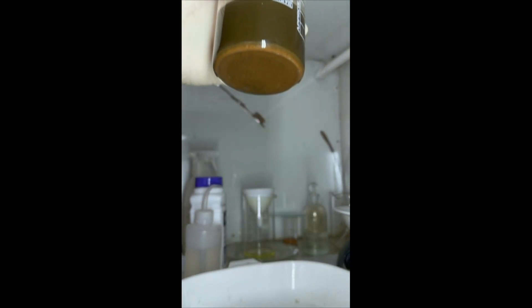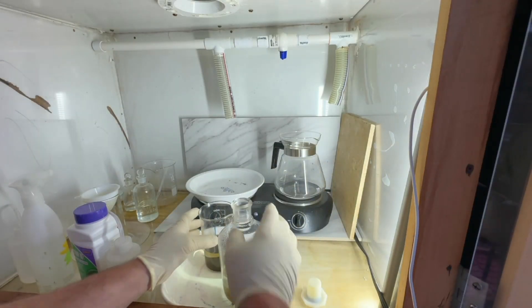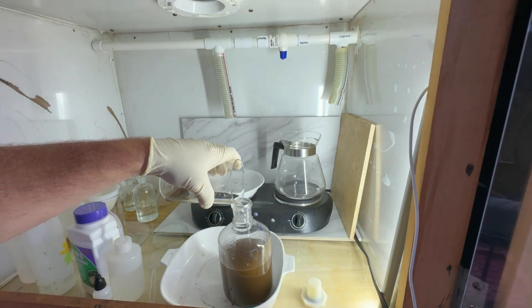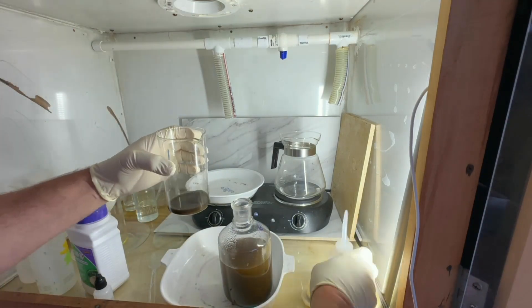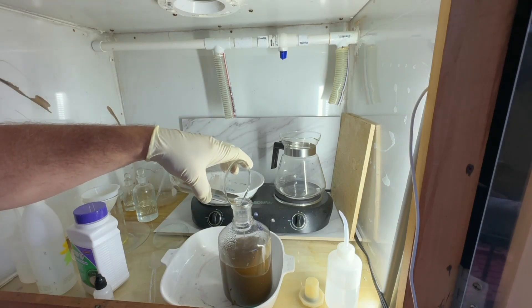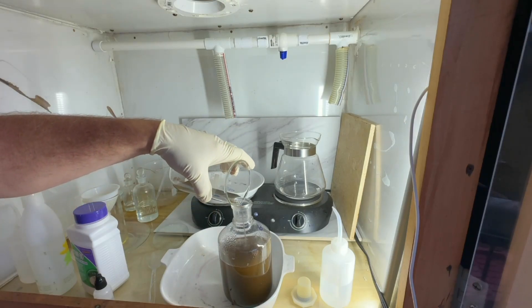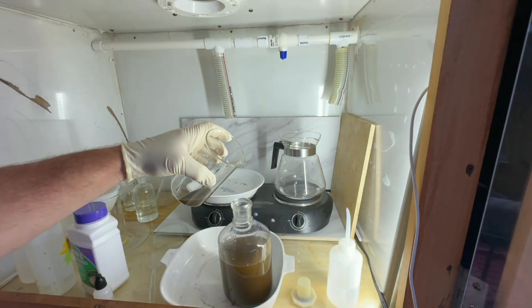I can see some nice gold settling on the bottom there. The storm's over, so we'll get started on decanting this, washing with distilled water, and cleaning up real well. It looks like really good powder. We're going to do some distilled water washes to get the chlorine solution off of the gold. We'll be coming back to do more purification when we melt it with other projects. It's pretty pure looking as it is — just a few more rinses with distilled water, then we'll set it up on a warm plate to dry.